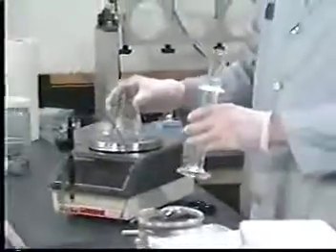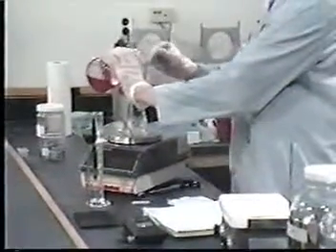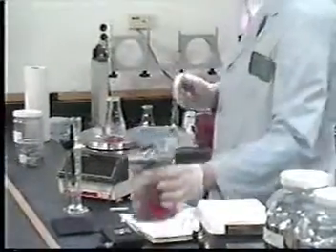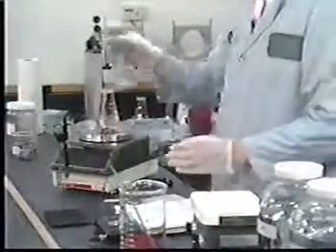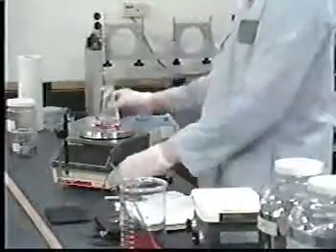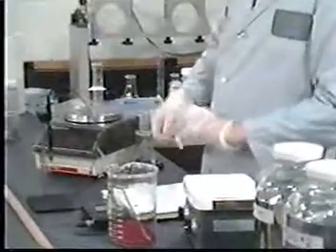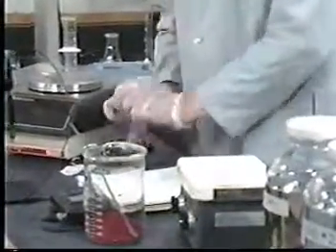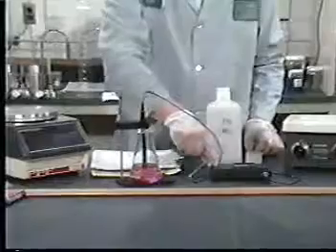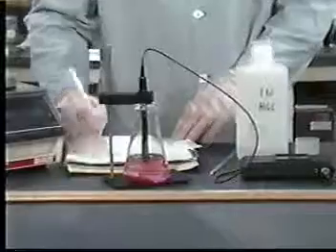The choice of fluid is based on the alkalinity of the solid. Weigh out a small subsample of the solid phase of the waste. Reduce particle size if necessary to less than 1 millimeter in diameter. Transfer 5 grams to a 500 milliliter Erlenmeyer flask and add to it 96.5 milliliters of reagent water. Cover and stir vigorously with a magnetic stirrer for 5 minutes. Measure and record the pH. If the pH is less than 5, use fluid number 1.